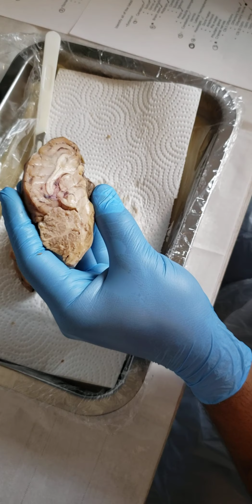All right, so now moving on to our mid-sagittal section. Turn my brain over. Okay, in the mid-sagittal section, our corpus callosum is easier to tell on this one. It is right in here.